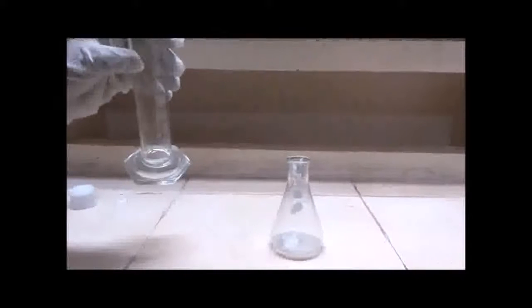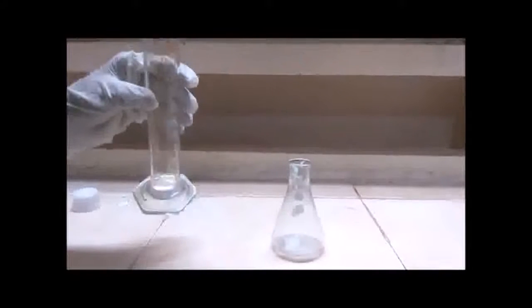After adding the white slurry, add 10 ml of ethanol. Now shake the conical flask vigorously until the white slurry dissolves in the ethanol. After dissolving, it appears to be transparent.